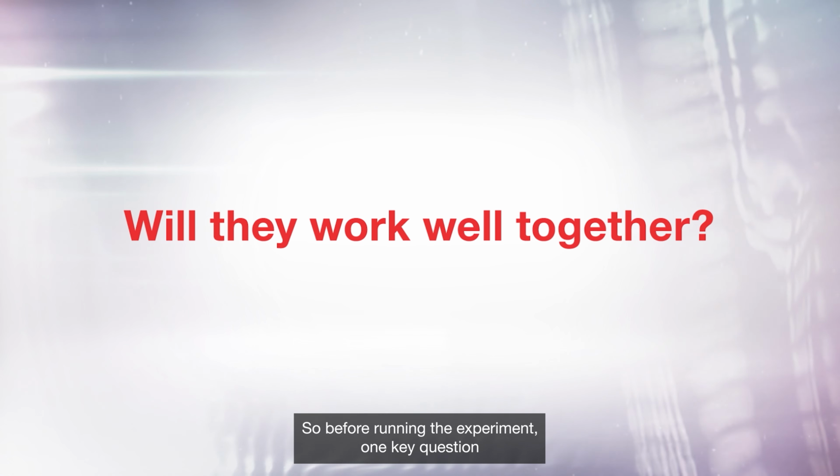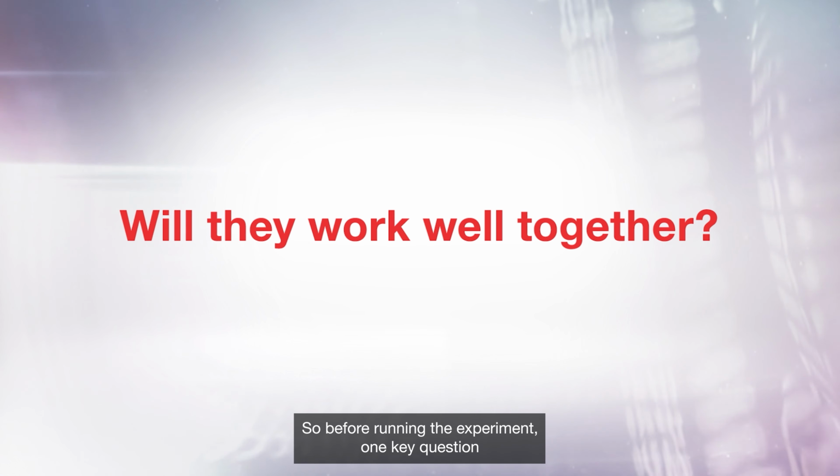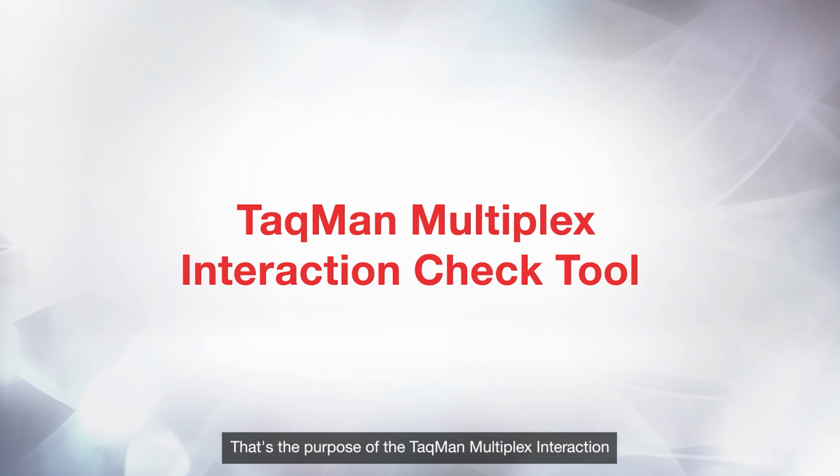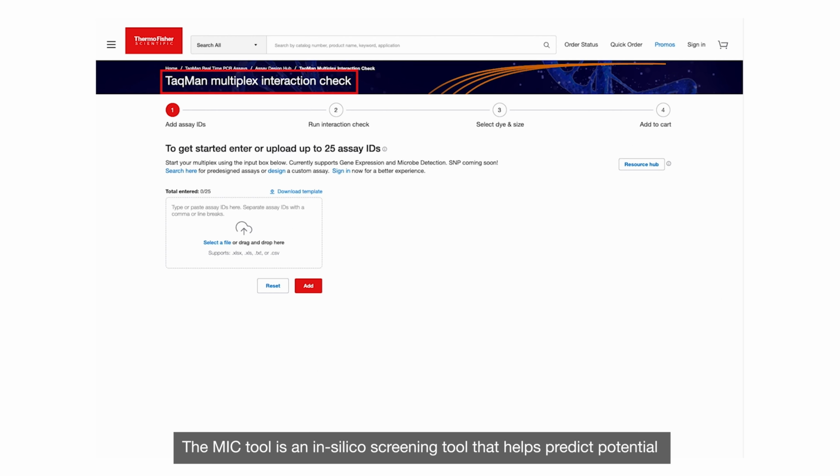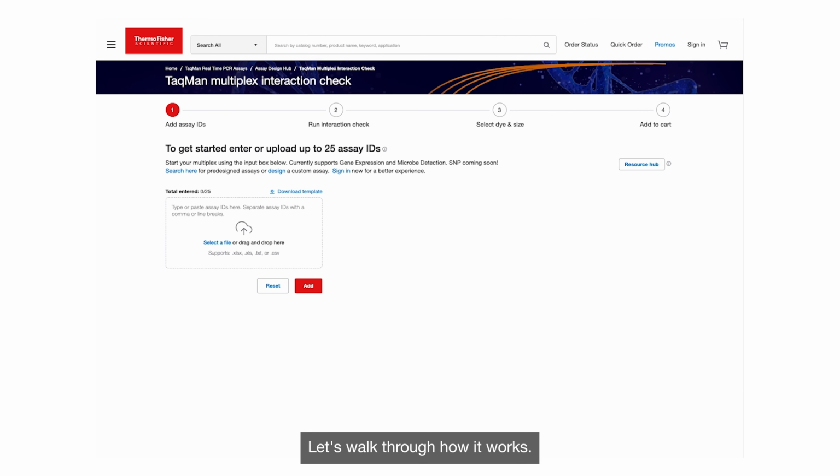So, before running the experiment, one key question remains. Will your assays work well together? That's the purpose of the TaqMan Multiplex Interaction Check Tool, or MIC tool. The MIC tool is an in silico screening tool that helps predict potential high-risk oligo interactions before you run your multiplexing experiment. Let's walk through how it works.